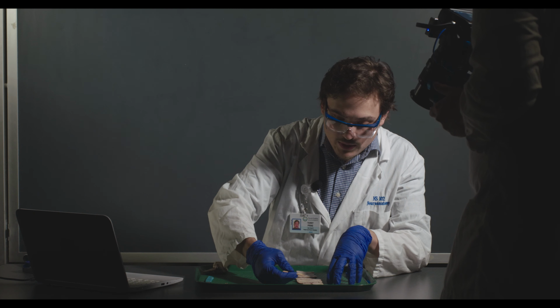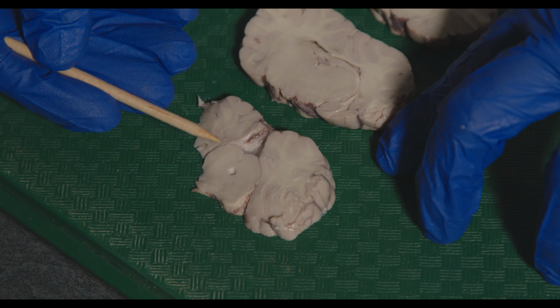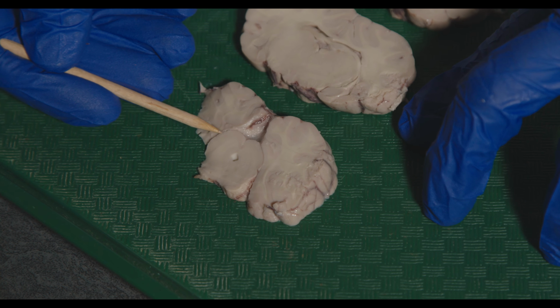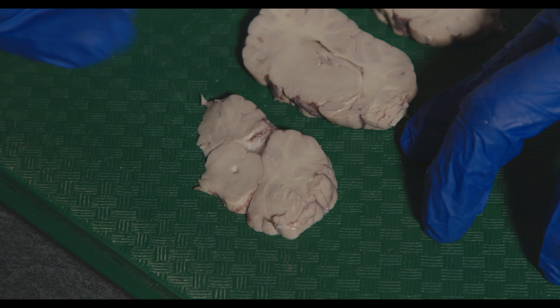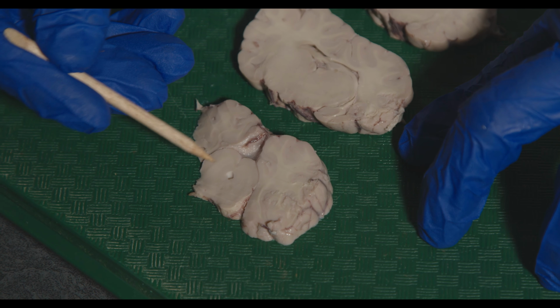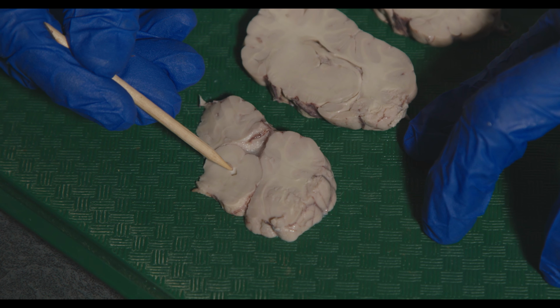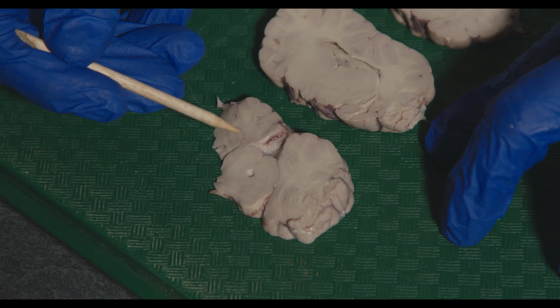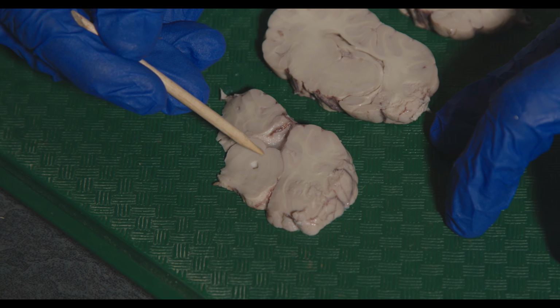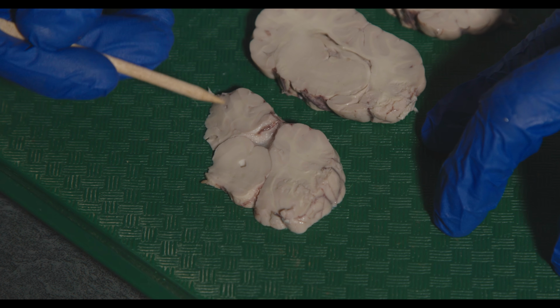If we go a little bit more caudal, now we're starting to hit the midbrain. So we can see the superior colliculi, which are these bumps here. This is part of the occipital lobe that we've cut off as we also did our cut. And then this guy right here, this is the cerebral aqueduct. So that's connecting essentially the third ventricle to what will be the fourth ventricle if we were to go further back and get to the cerebellum. Okay, so that concludes the sheep brain dissection.